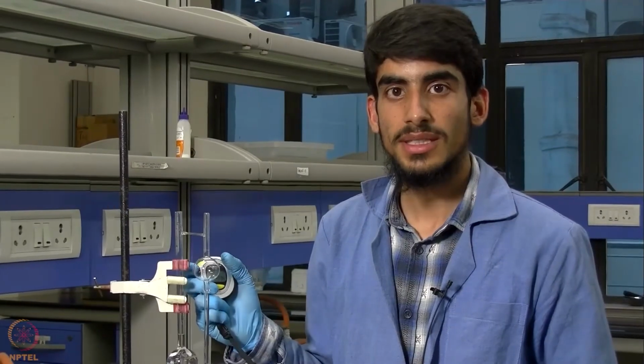So now that we can see that our liquid has flown between these two edges, we will now do it again for the same sample, and we will repeat this 2 times more. We will then take the average of all these 3 readings and use these readings for our further calculations.